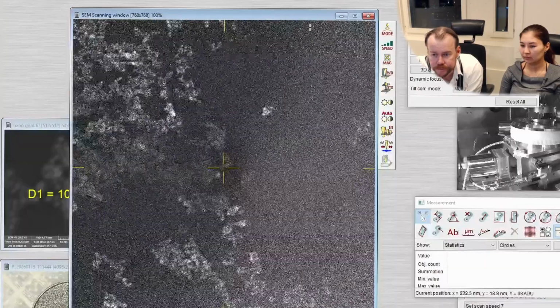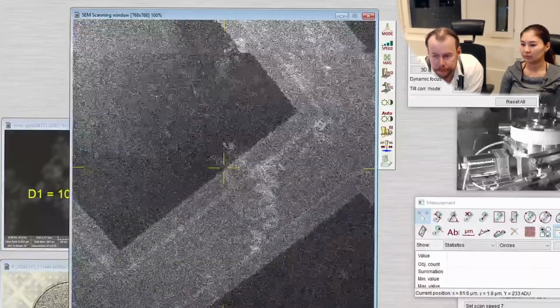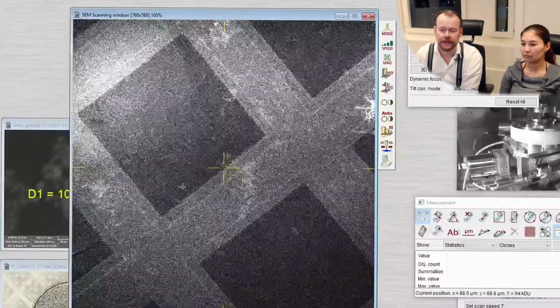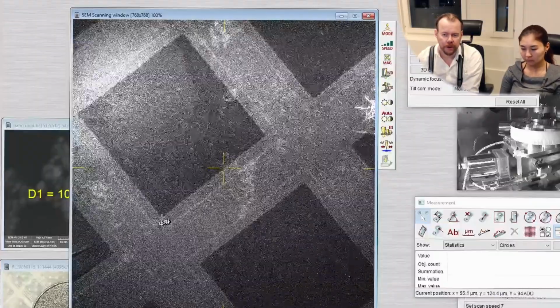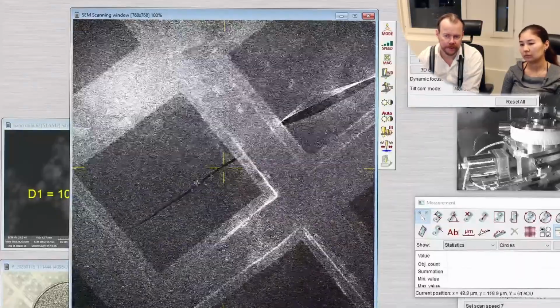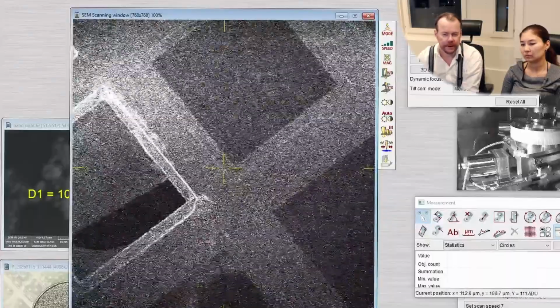So what we can do now is let's go and look on the particles. You can see that these bars, that's the copper mesh, right? Yeah. And then the carbon film covers the holes, but some places it has broken. Here you see it's broken. Here's a crack also, and here's a big hole.